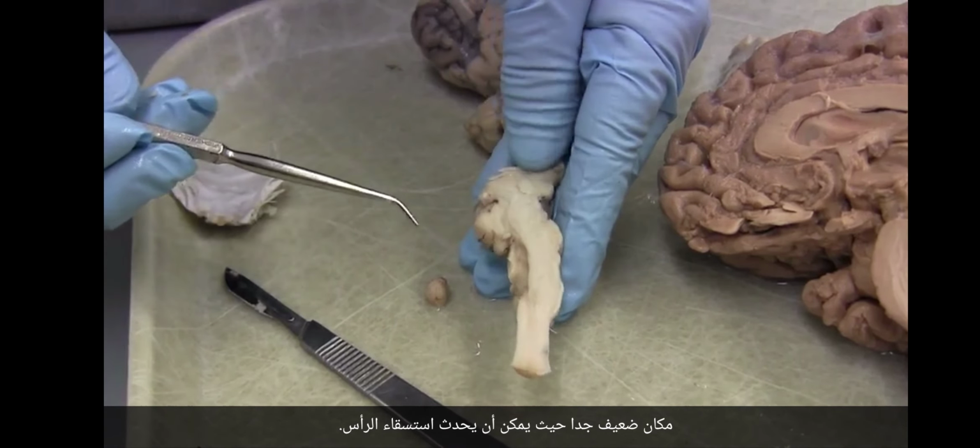The fluid, the CSF, flows back from the lateral ventricles of the forebrain, of the telencephalon, back through this third ventricle, which is in the diencephalon, through the cerebral aqueduct, through the fourth ventricle. And when it gets to the fourth ventricle, it comes out through three holes. This is one of them, foramen of Magendie, and then on either side, 1 and 2, there is the foramen of Luschka. So there are three holes. Foramen of Luschka on the left, foramen of Luschka on the right, and Magendie.